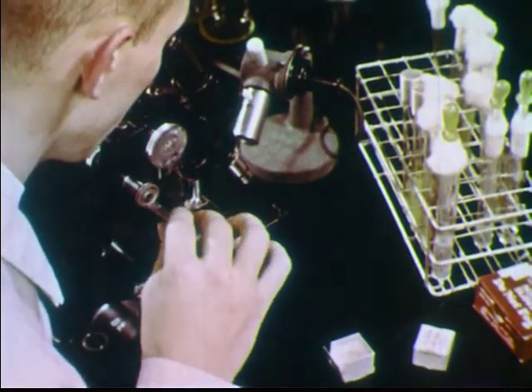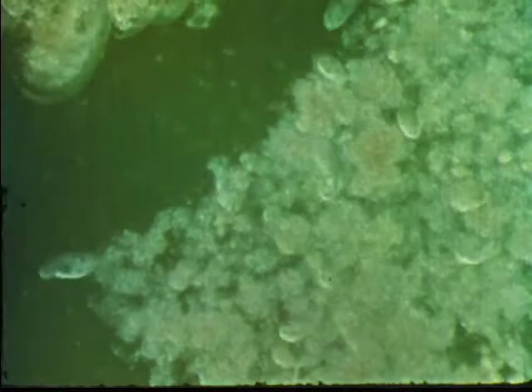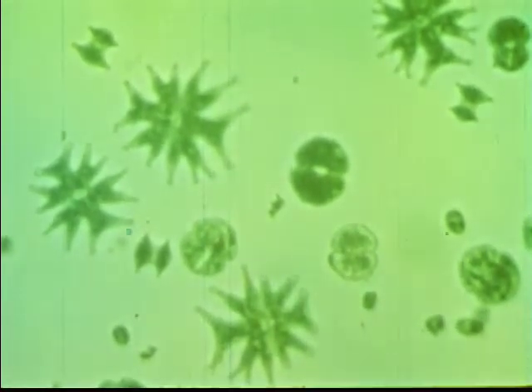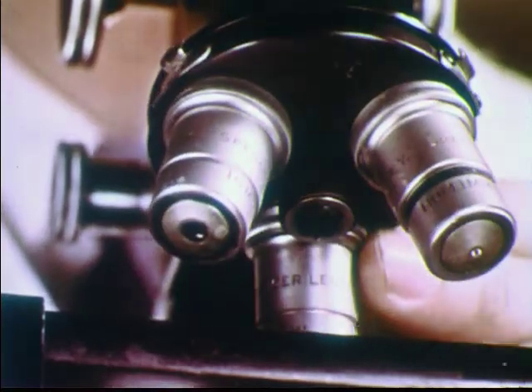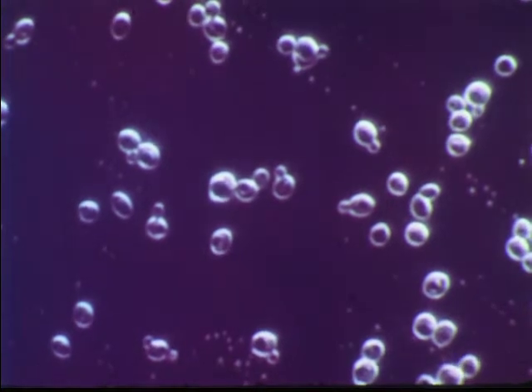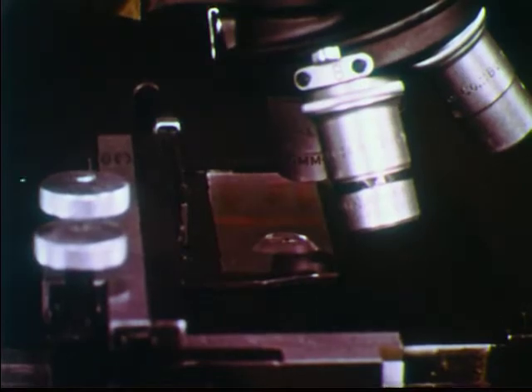Low magnification with the microscope reveals protozoa — one-celled microorganisms, animal life in its most primitive form — and algae, microscopic green plants capable of food production by photosynthesis. Higher magnification is required to study yeast, single-celled plants.